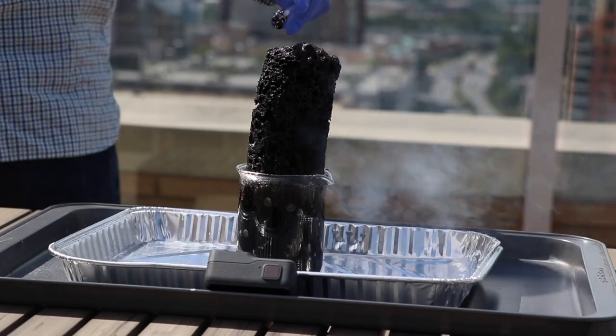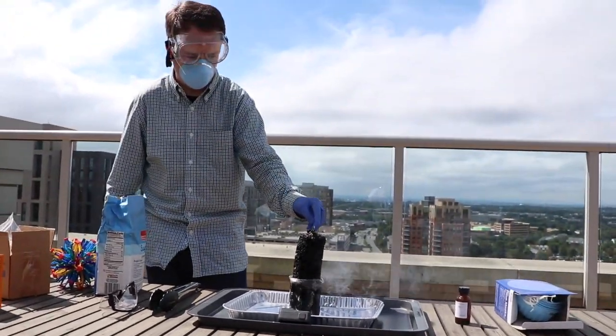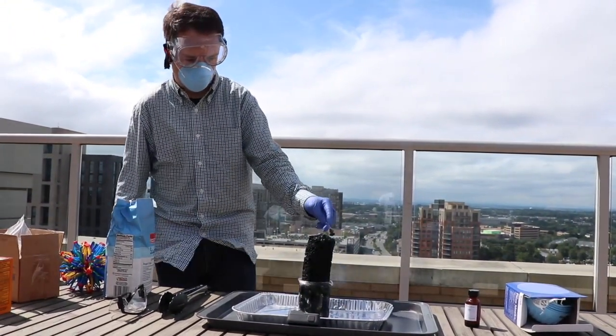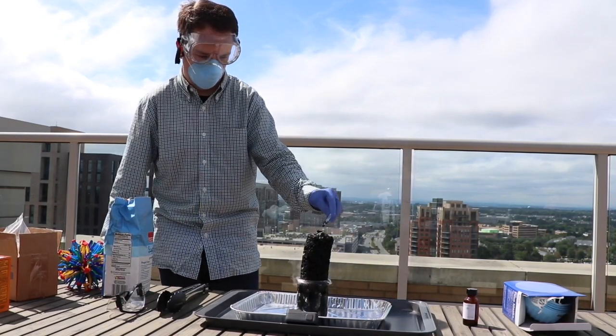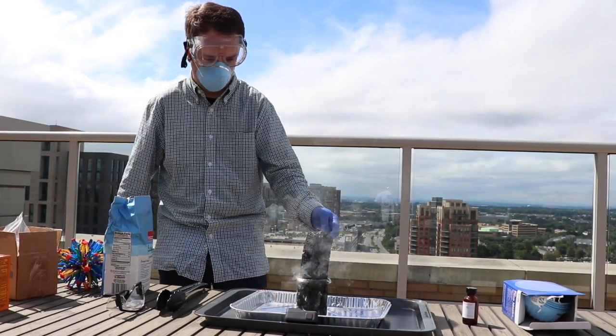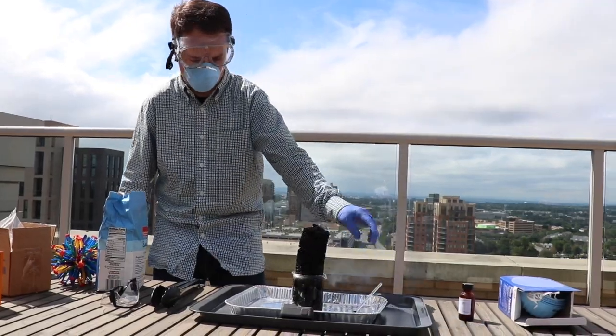As you do the reaction, you notice the smell. It kind of smells a little bit like burnt syrup, precisely because you think about what syrup practically is. It's mostly sugar in there. So as you burn the sugar, it gives off this very unique smell to it.